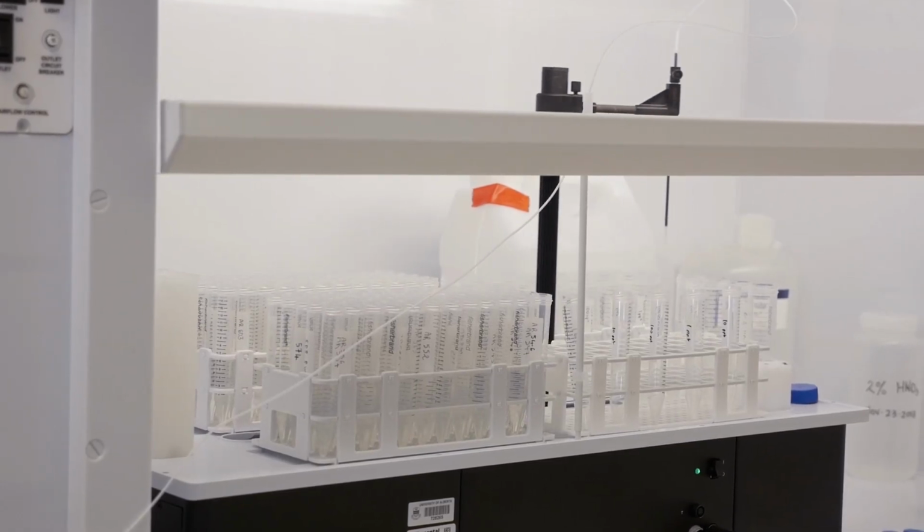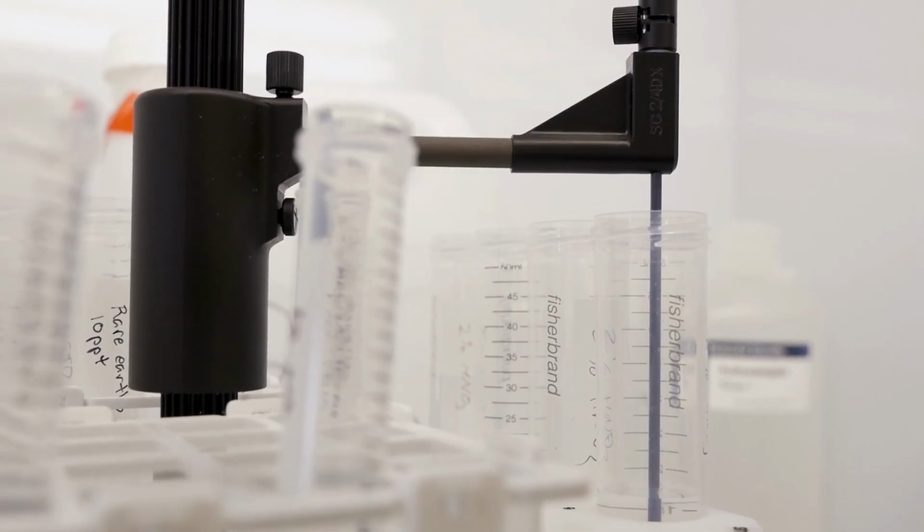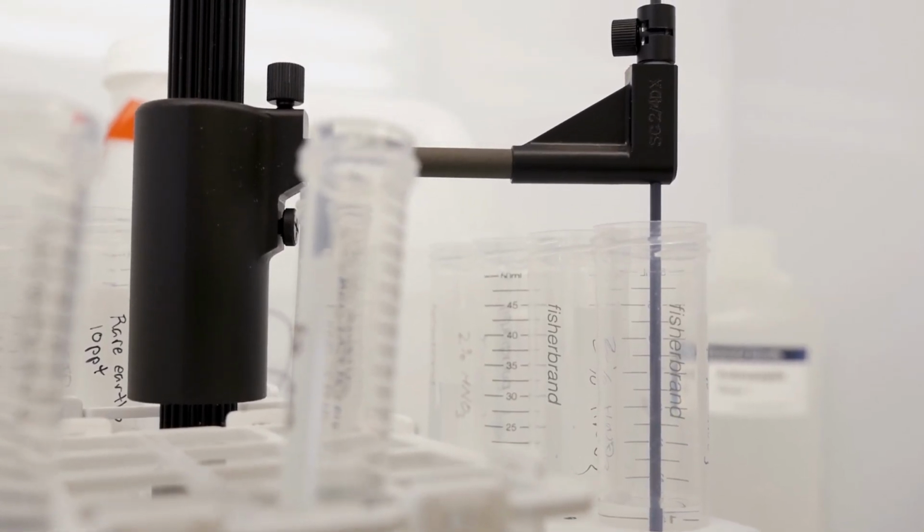That is really important to measure or to determine at that low level, because when we are talking about a contamination anywhere, in water, in soil, in fish, or in any sampling matrix or type, it is important to have a low level of background or your blank value at that low level, so that you can differentiate between the not contaminated and contaminated samples. So for that reason, it is really important that your background is really many orders of magnitude lower than your samples.